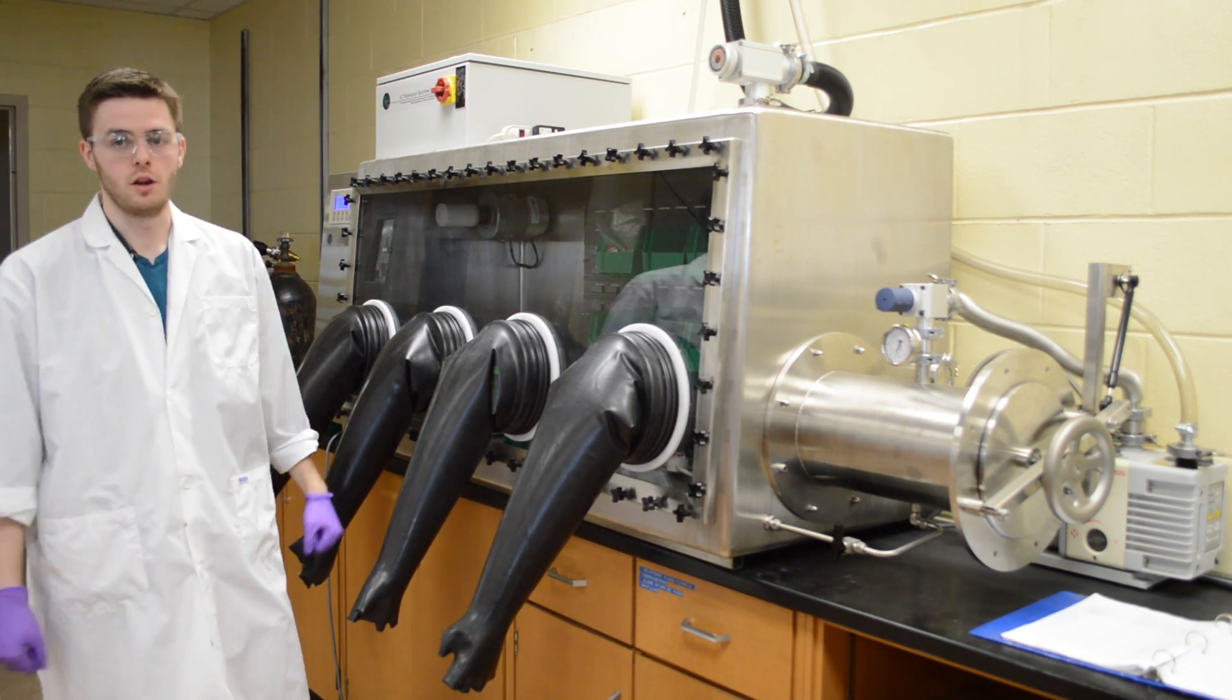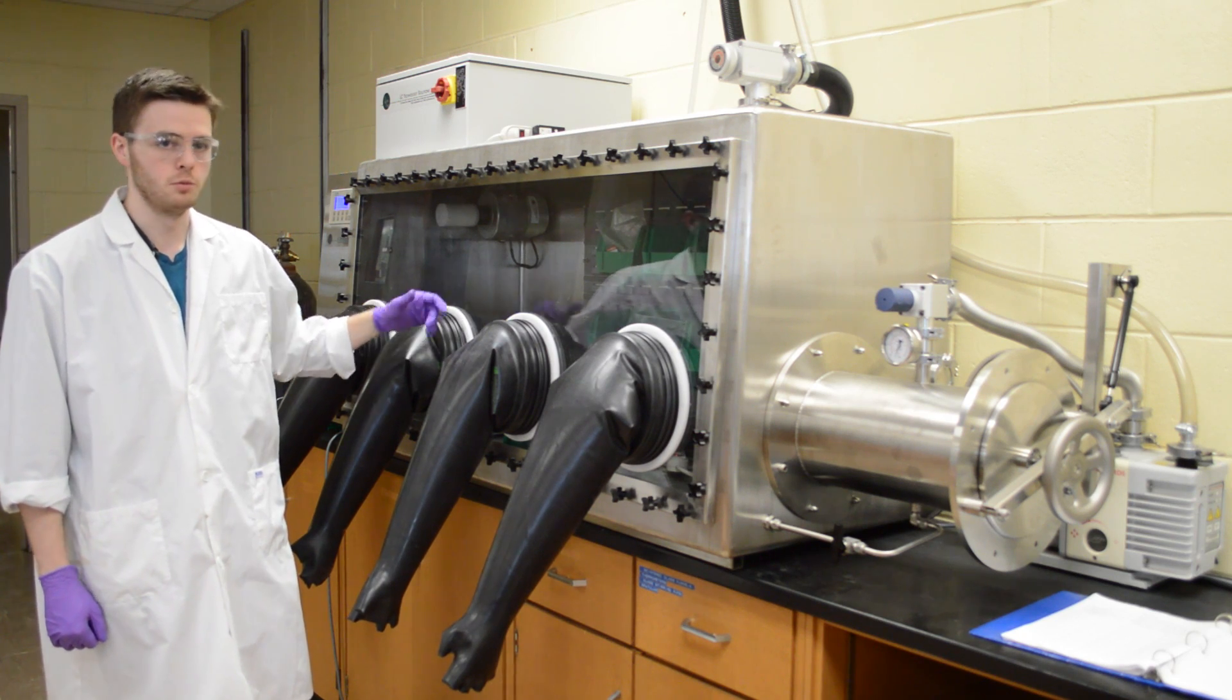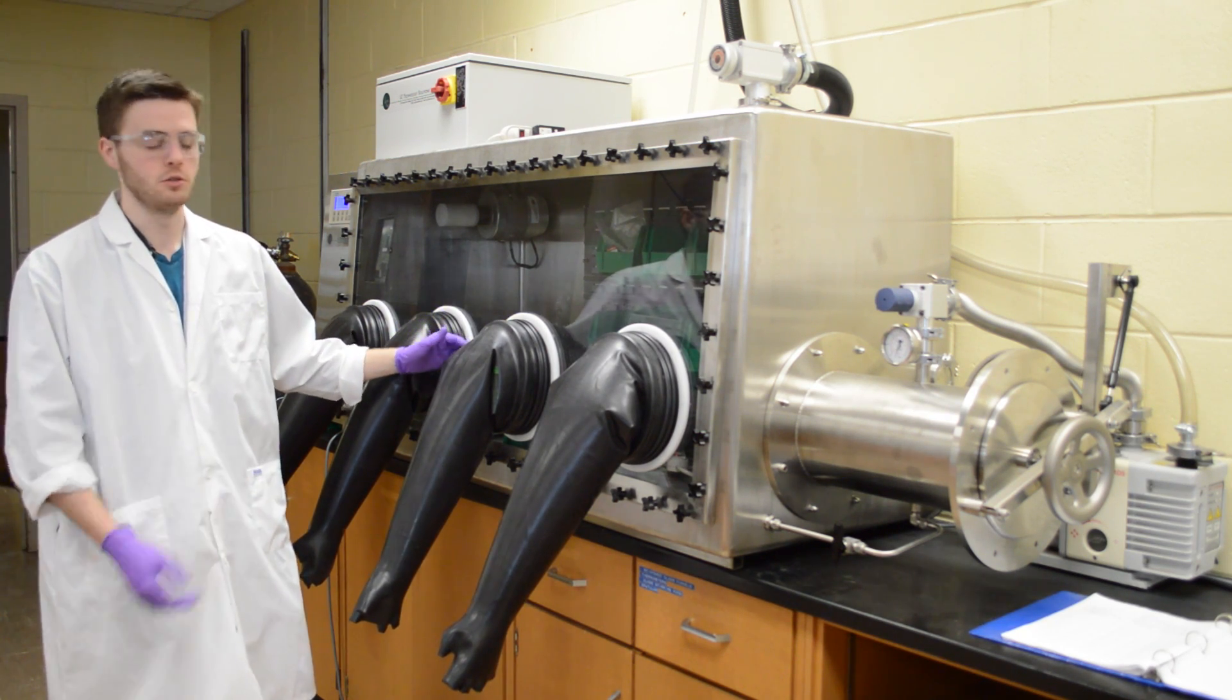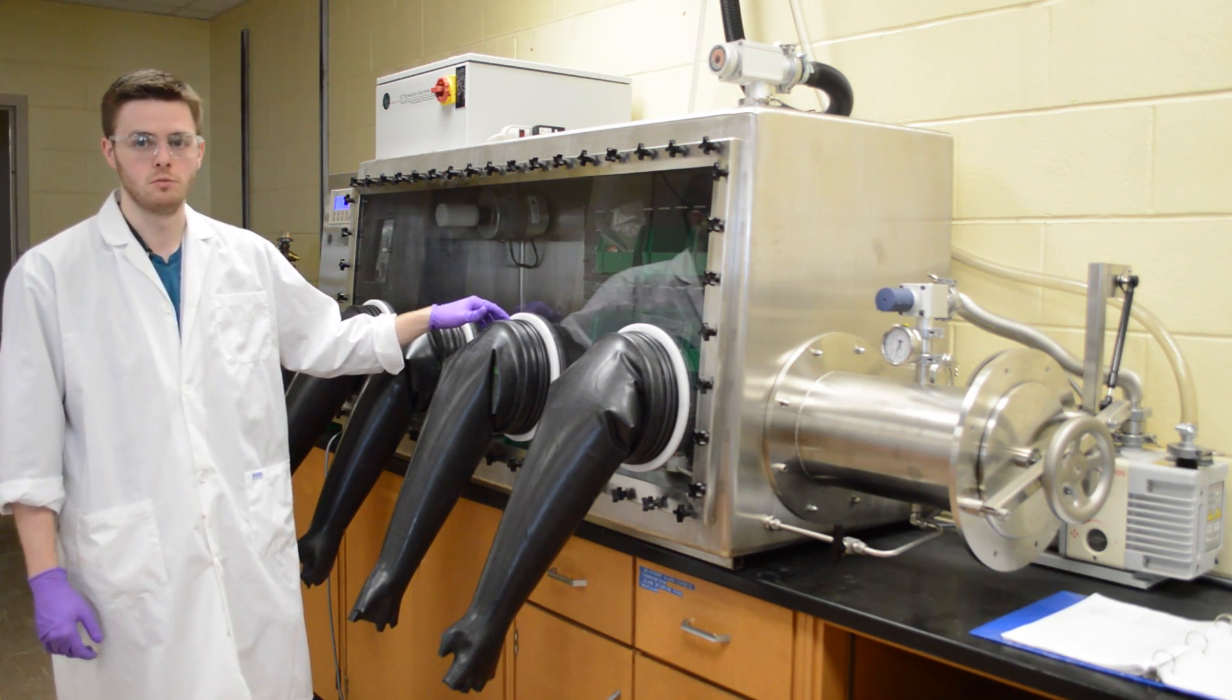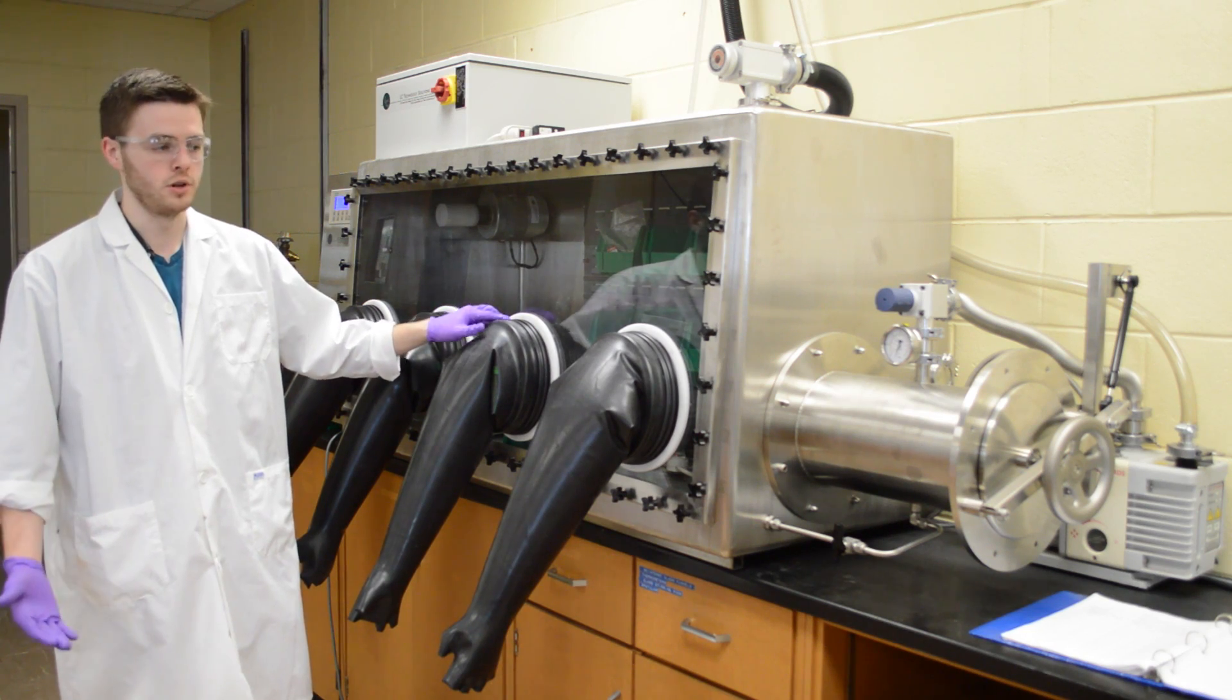Since we use this for air-sensitive chemistry, a lot of times you'll need to bring things in and out. We keep a lot of materials in here just so that they don't hydrolyze or break down.